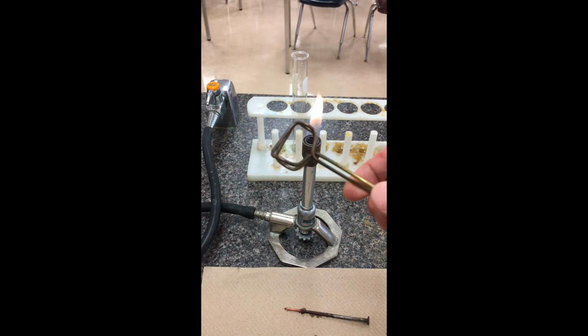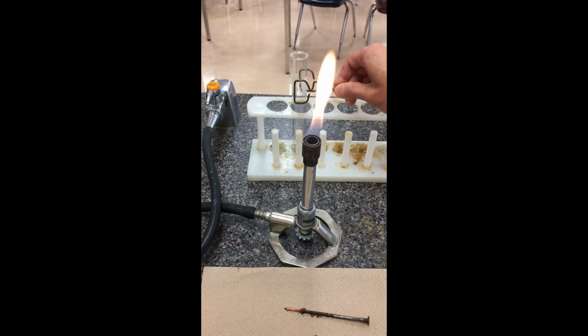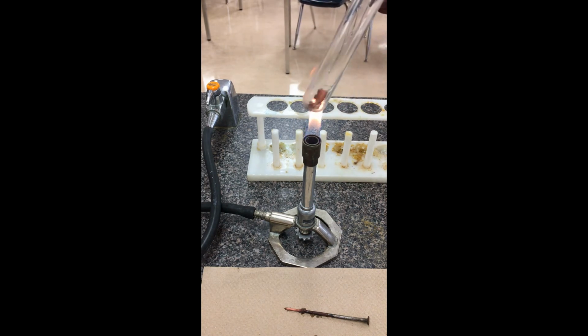I'm going to take a pair of test tube clamps and grab the test tube, and again, it's very quick, just moving it around. Again, make sure you don't point the open end towards yourself. I don't want any soot developing on the test tube as well, so I'm just going to do a quick flame dry like this. Hopefully you can evaporate off some of that leftover liquid. You could also leave it overnight and let the rest of it evaporate, but this is just a slightly quicker method of trying to dry it off.